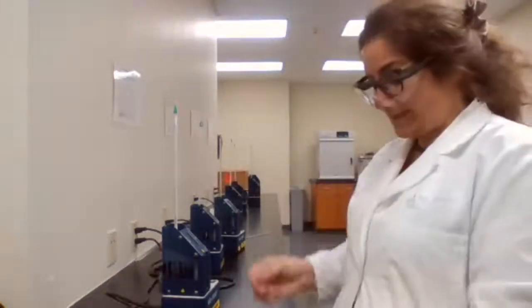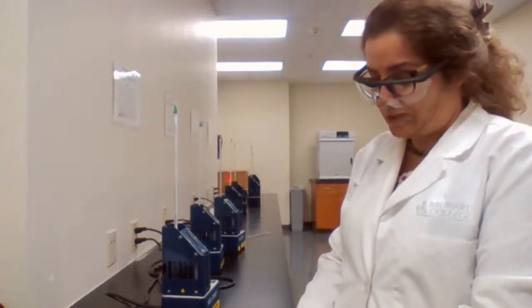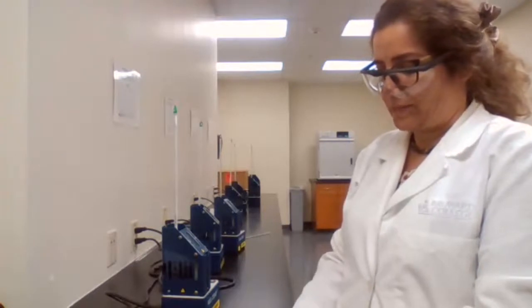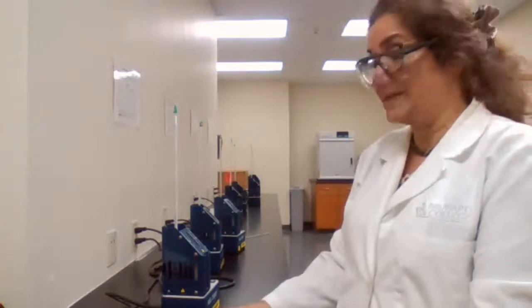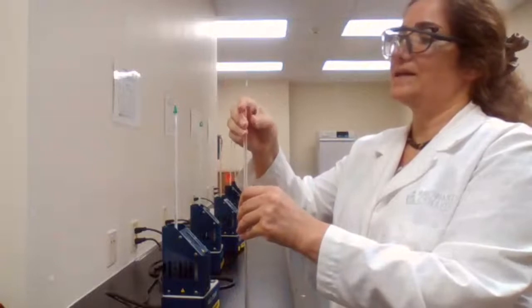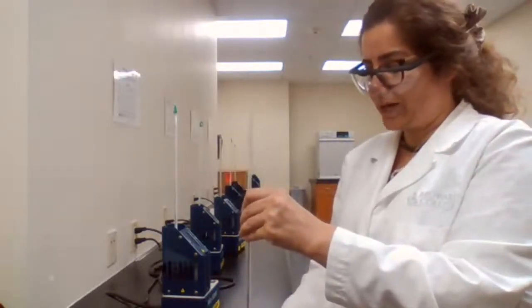If I'm using the same machine, I'd be better off measuring the melting point of the ether first, because benzoic acid melts at a much higher temperature. Why? Because benzoic acid is an organic molecule with the carboxylic acid functional group, and it has an OH group.